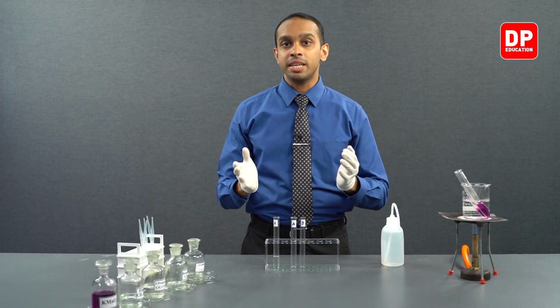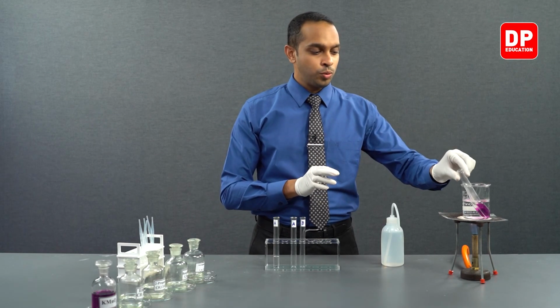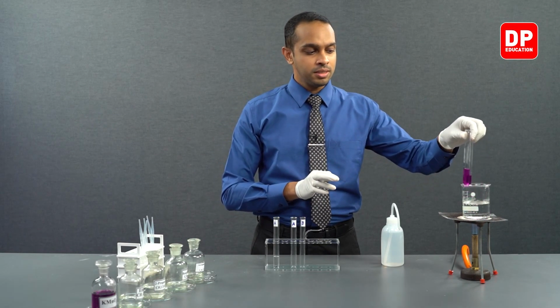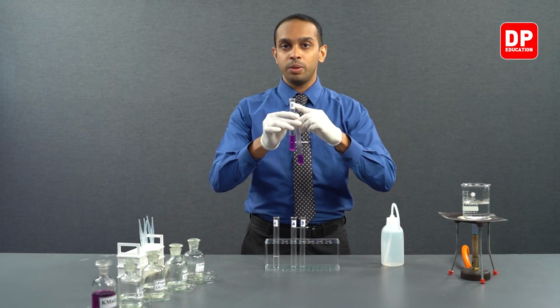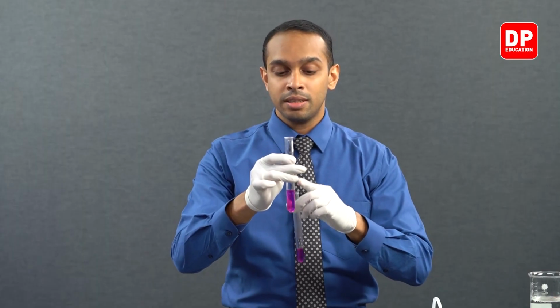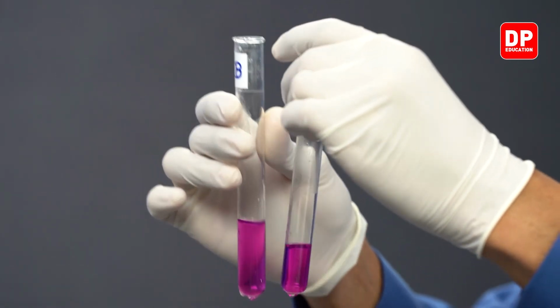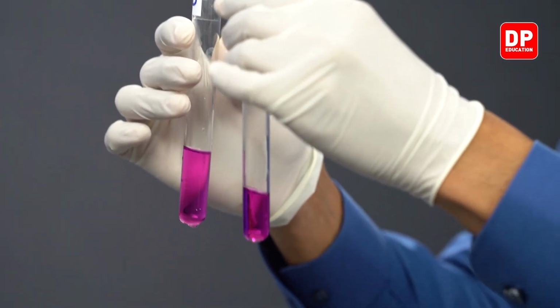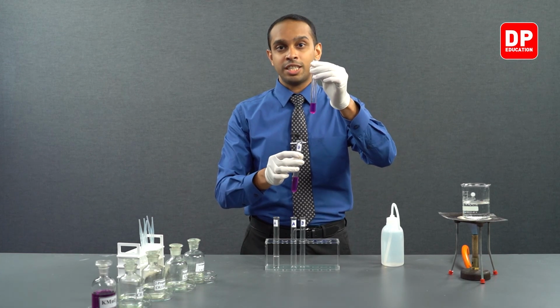Students, it has been a while now. I have allowed it to heat up for a while. Now let's see what has happened after we provided it some heat. So we have here our two mixtures. We have the test tube labeled B, which had acidified potassium permanganate and acetone. And on my left hand, we have our potassium permanganate solution that is acidified.